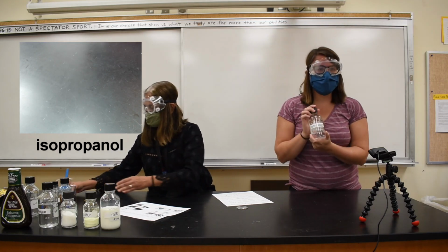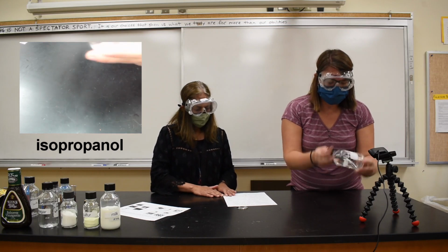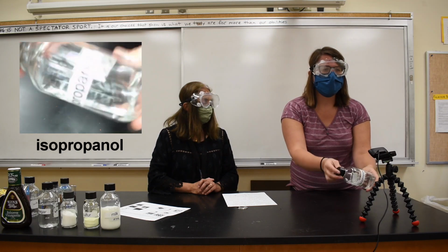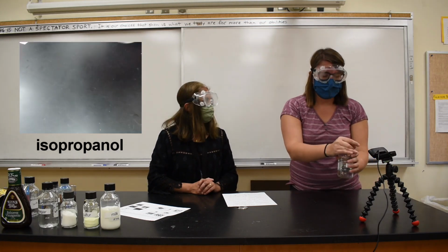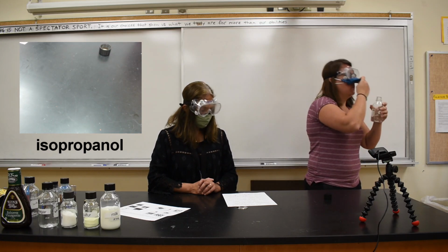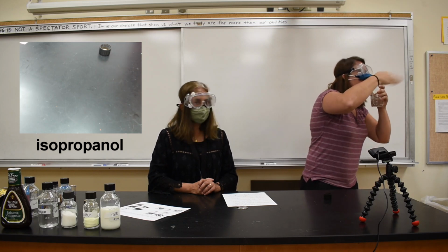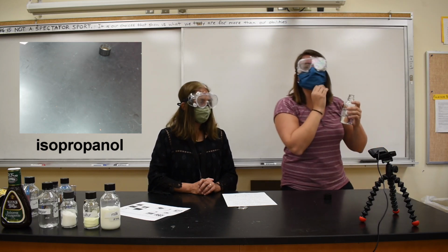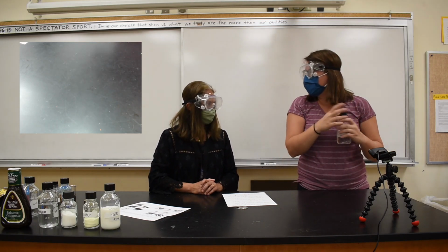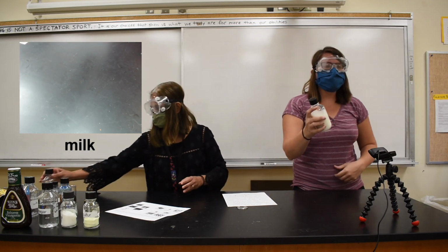Next is isopropanol. It's clear, it's a liquid. It flows very easily. Maybe even more easily than water. Can you safely smell that, Miss Sullivan? I think I can. Whew, it's very, very sharp smelling. Normally I would try to show you the waft, but it's a little bit hard when you've got so much protection on. It kind of smells like a doctor's office. Isopropanol.